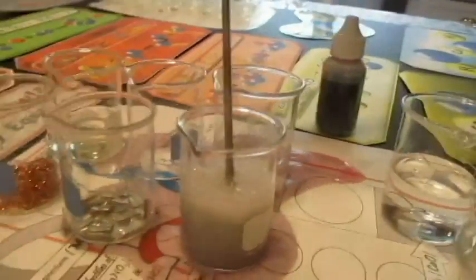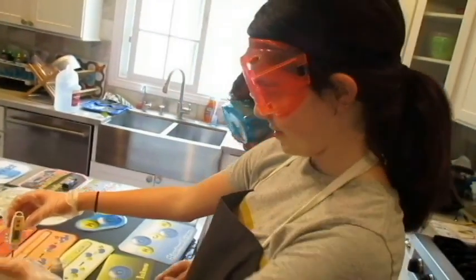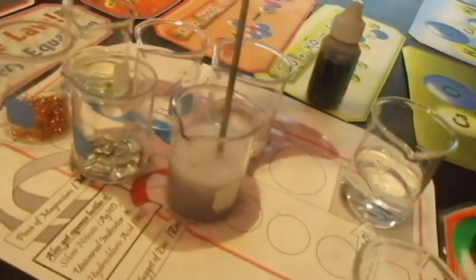Can you give me any information that students might want to know right now? It's turning darker, and it's bubbly a lot. And what else? What about a smell? Yeah, it smells really bad. So the students can't smell it on videotape.